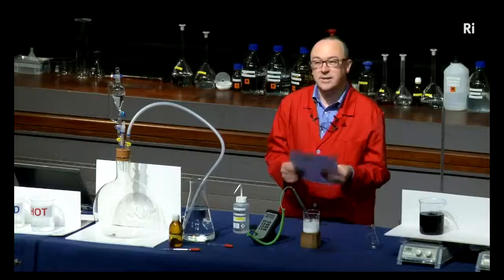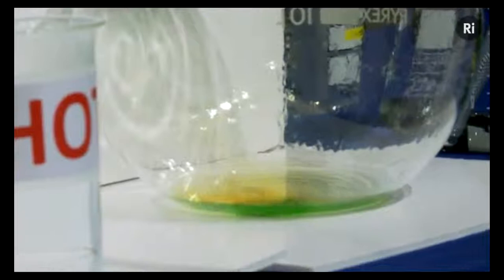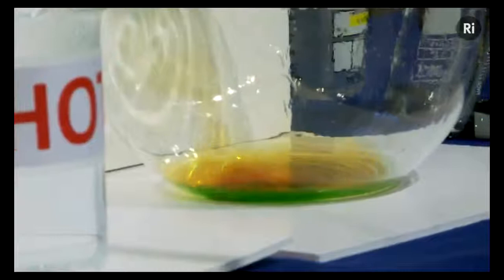I'm prepared to make an observation. So let's add the nitric acid to the copper and see what happens. I think you can see that quite a vigorous reaction is taking place. We've got some sort of green liquid, it's bubbling away, and some fumes are coming off.